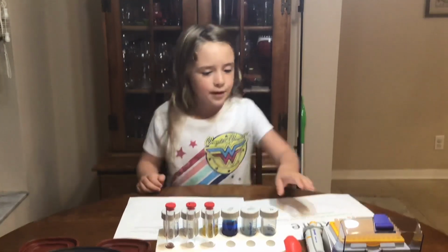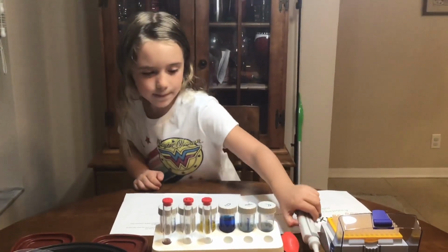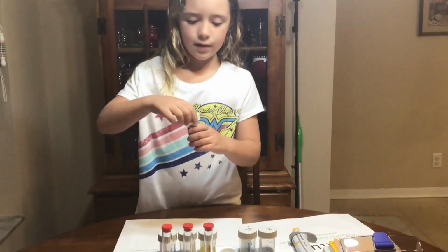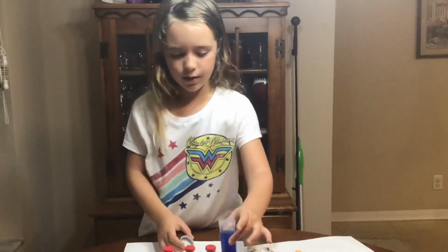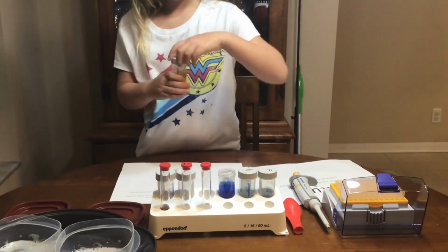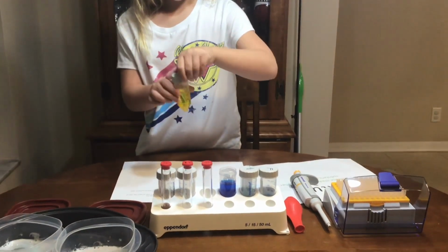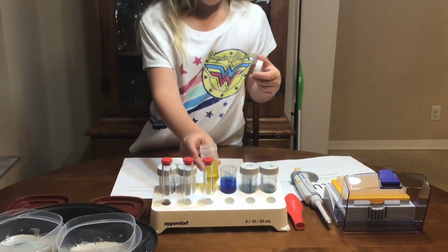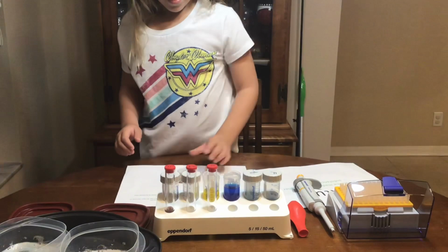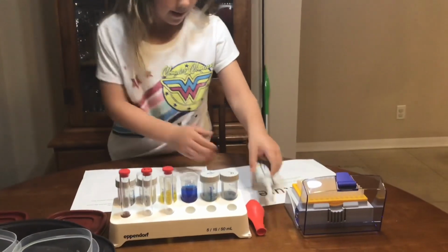I don't know. So let's take our pipettes. I should open this first too.